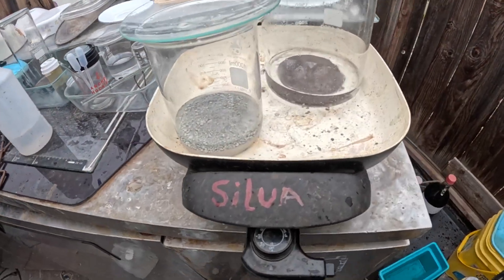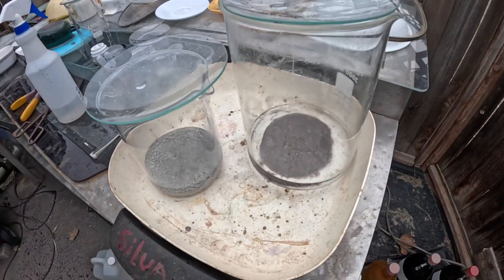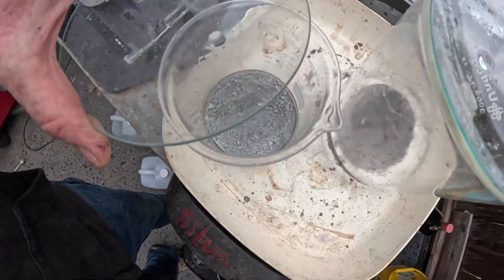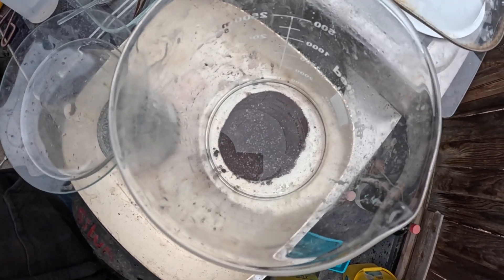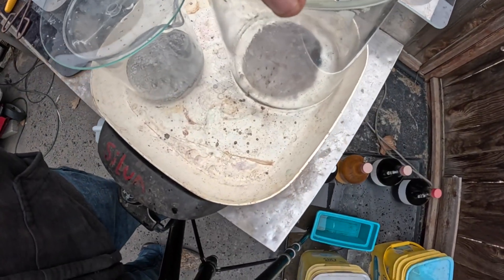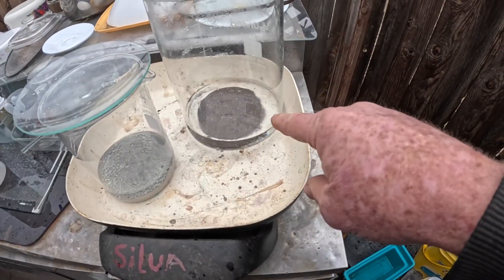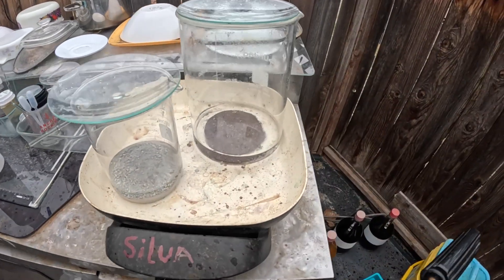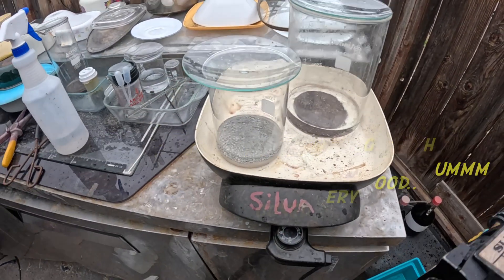Okay, that's over. This one looks gorgeous here. This guy, not so much — pretty dark. That's a good one. Pretty dark over there. Got to find out what's going on there. I cleaned it up as best I could. This was kind of like the second extraction of silver from this stuff, so it's pretty dirty looking. I'll melt it and see what happens.